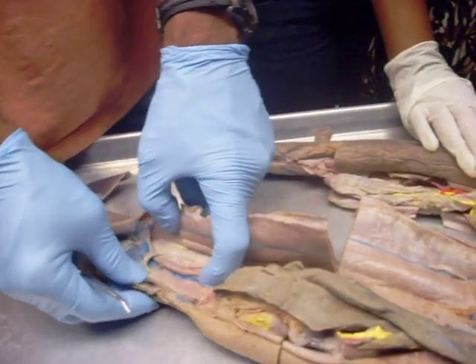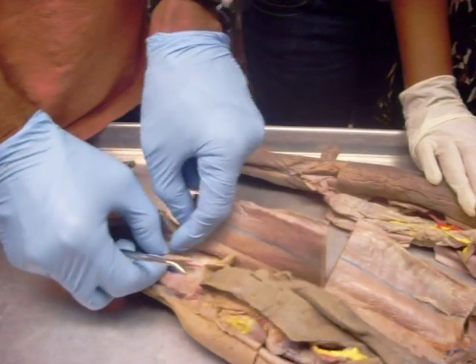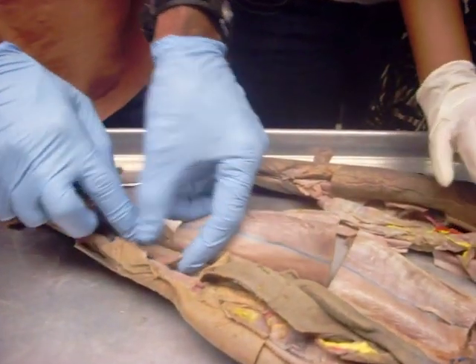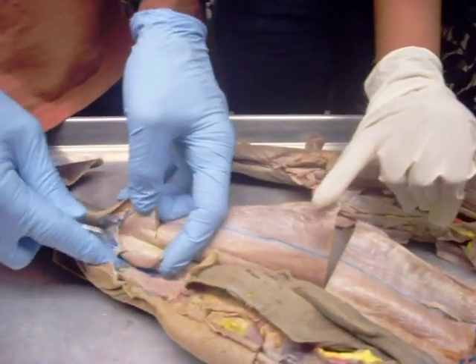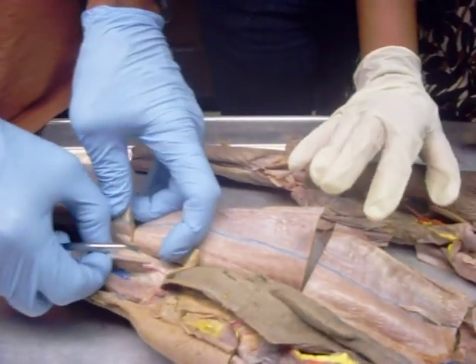Just inwards from that is this — this is the rectal gland. I'm just going to ask you structure, so I'm not going to go over what they do.